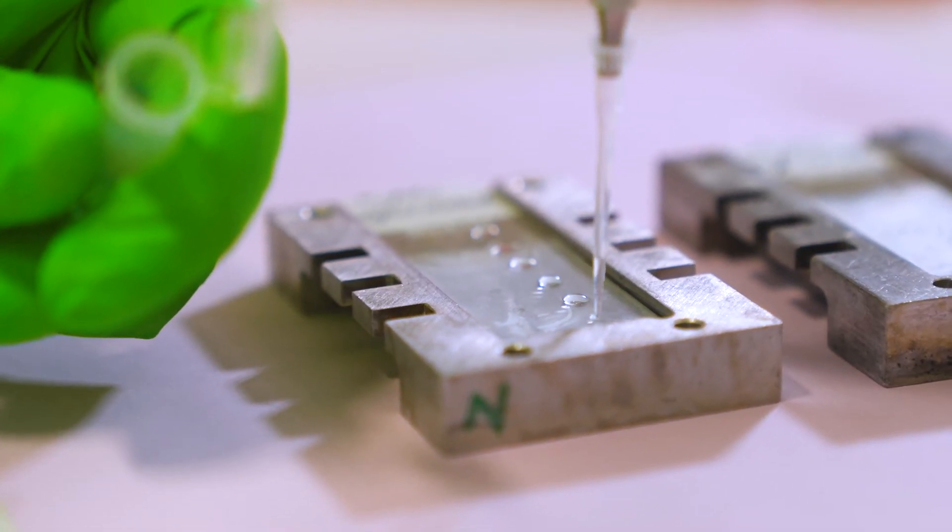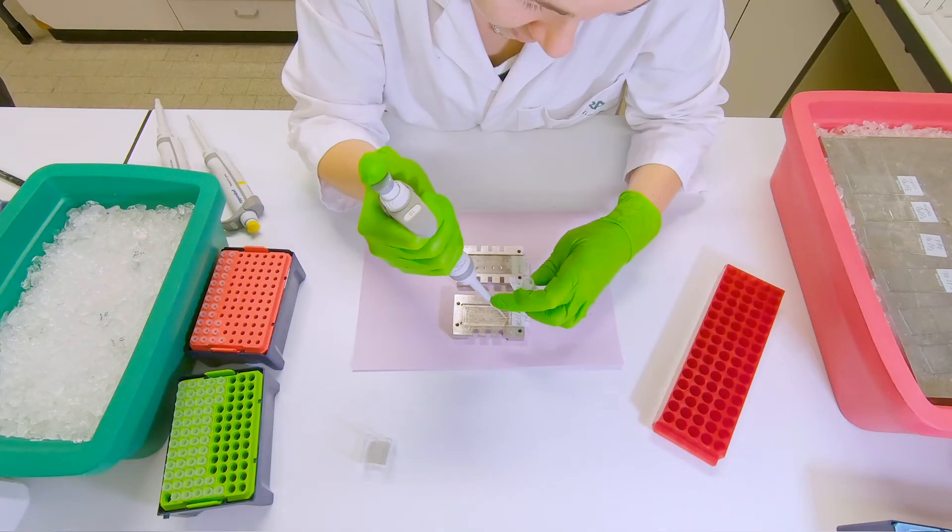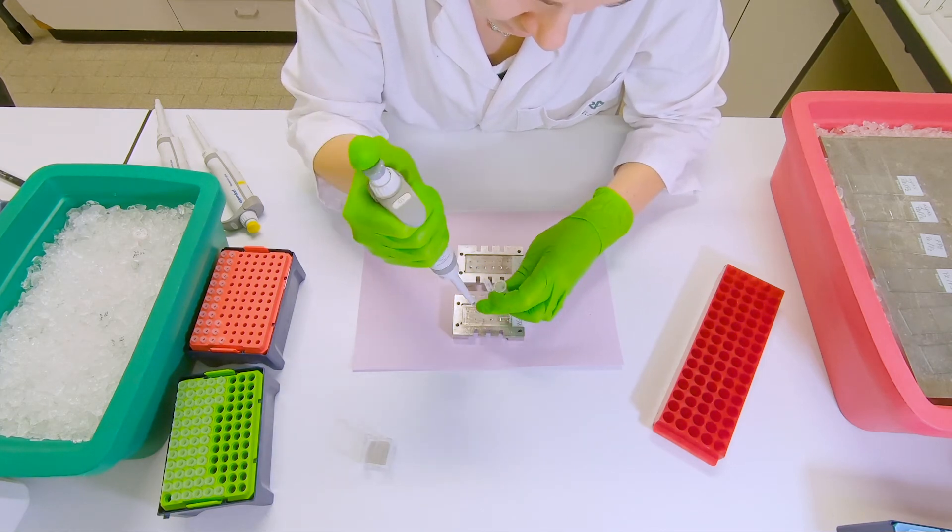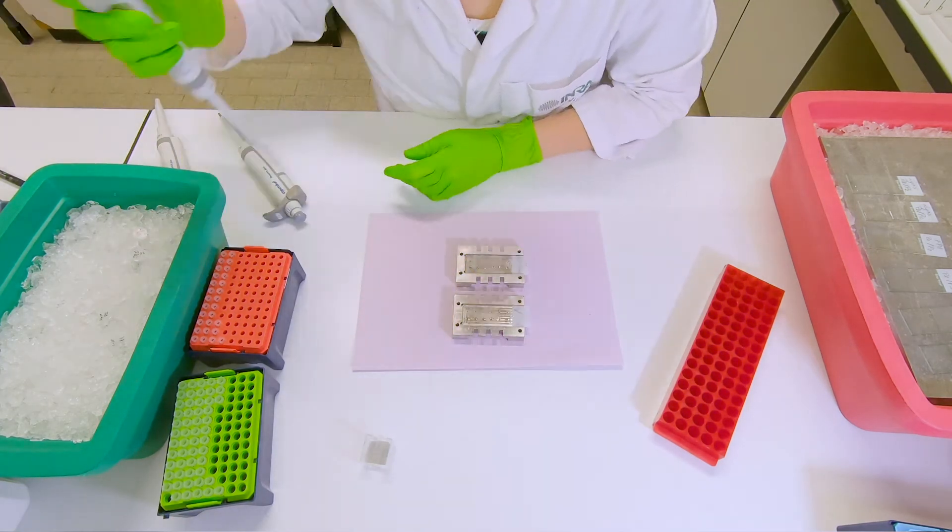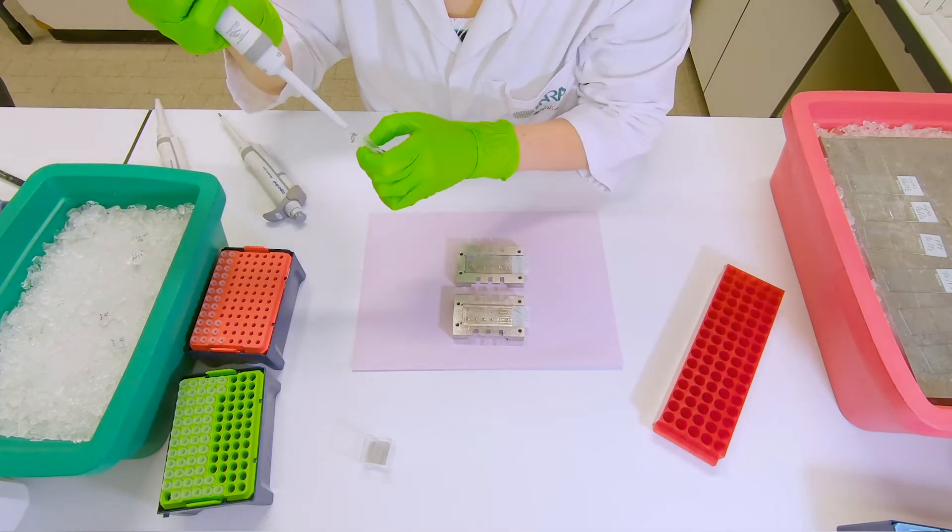To do that, follow the pattern of the 12 slide unit. But in this case, a cover slip will not be used, and the shape of the gel will be the dome.